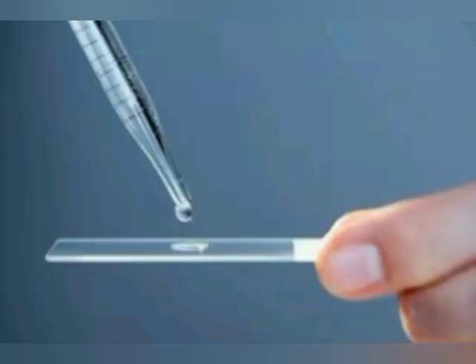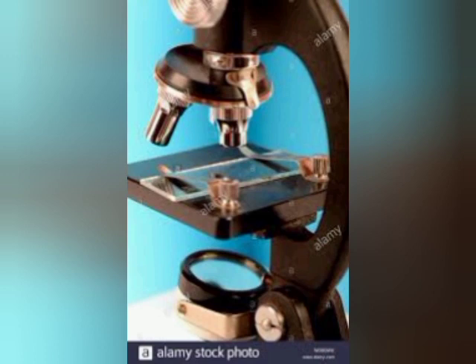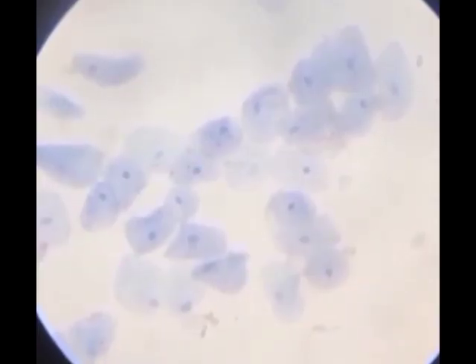Keep the layer of cheek cells on the slide and add some drops of methylene blue. Keep it aside for two minutes, then wash it with water to remove the extra stain. Add a drop of glycerin to remove air bubbles, then cover it with the coverslip.